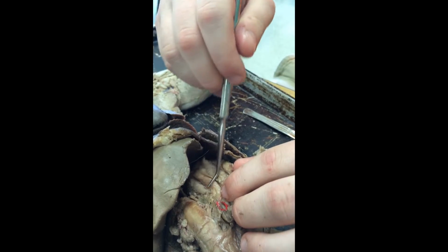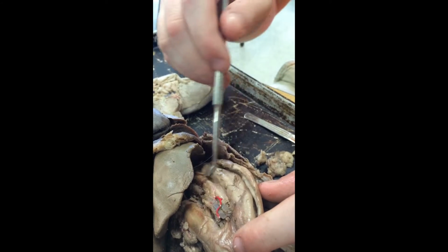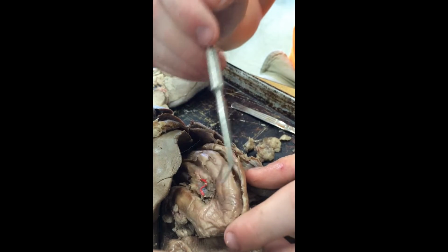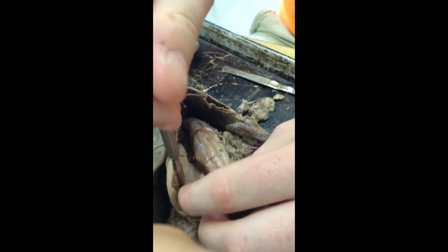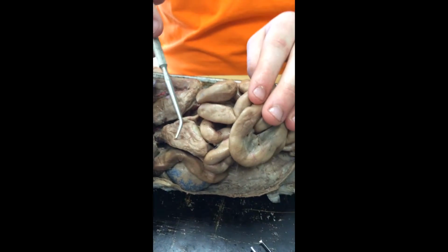Right next to the region to the left, we have the fundus. Most of the stomach, basically the middle, is the body of the stomach. And then the bottommost region is the pylorus. And then we have another sphincter which enters into the small intestine, which is the pyloric sphincter. And the pyloric sphincter enters into the duodenum, which is basically the top of the small intestine.